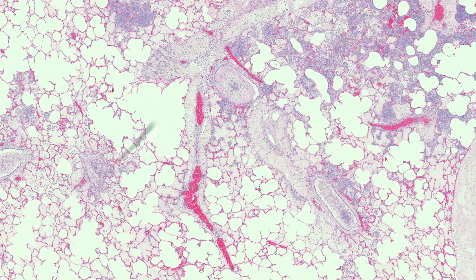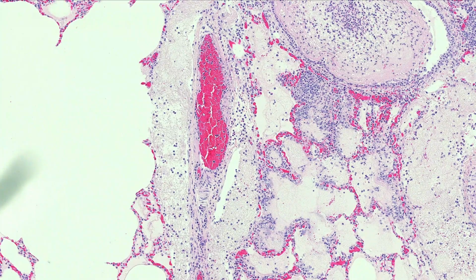During acute inflammation, endothelial cells switch on and become quite active. They become hypertrophic, which is the term for increase in cell size. This is particularly visible in the nuclei. To show you this, we're going to switch to a section of sheep brain with a Listeria encephalitis.